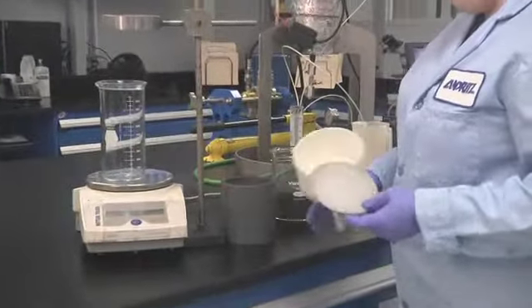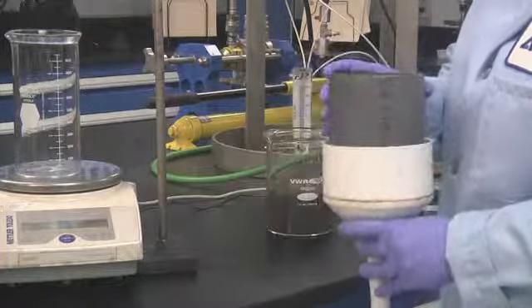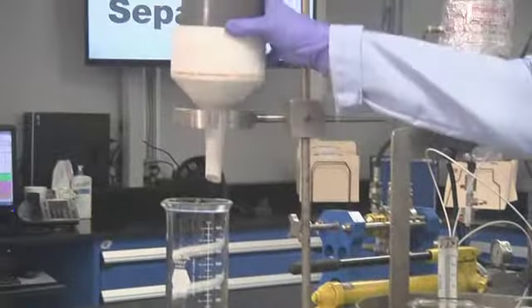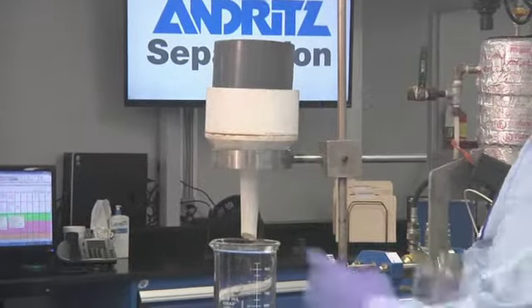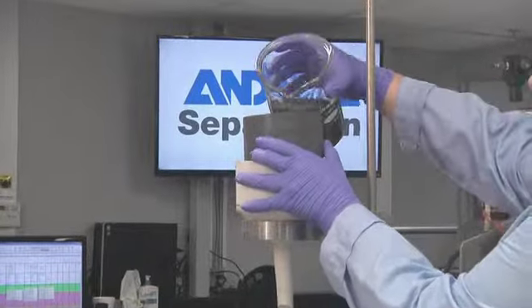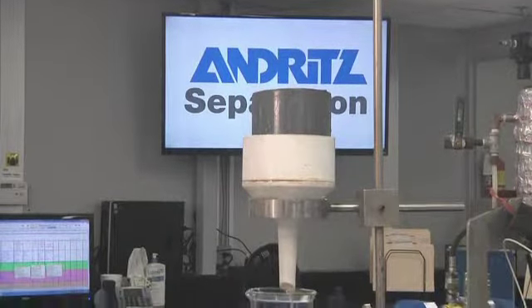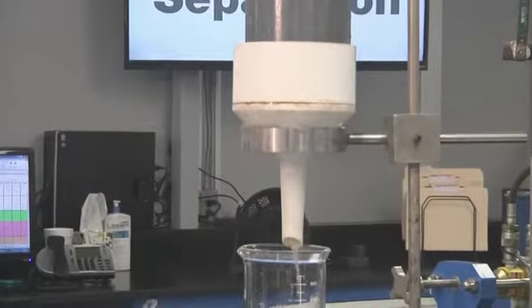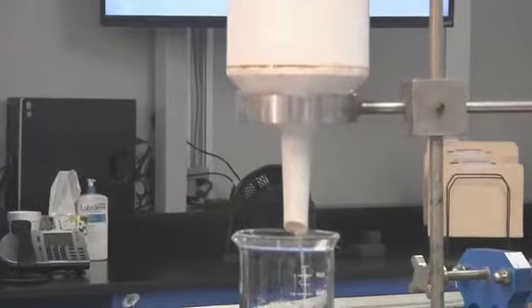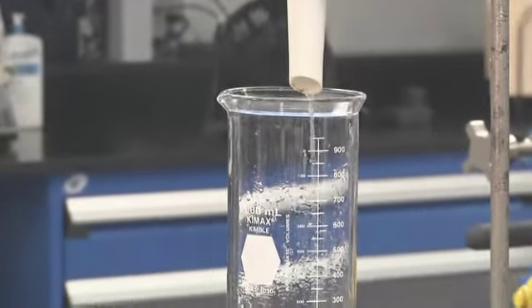The drainage curve test is conducted by adding flocculated sludge to a funnel to watch the characteristics of the drain. After preparing the sample and drainage curve apparatus for testing and entering the sample volume, total solids, dilution water volume, and polymer volume in the drainage curve sheet, pour the sample onto the fabric in the funnel of the static thickener drainage curve apparatus.